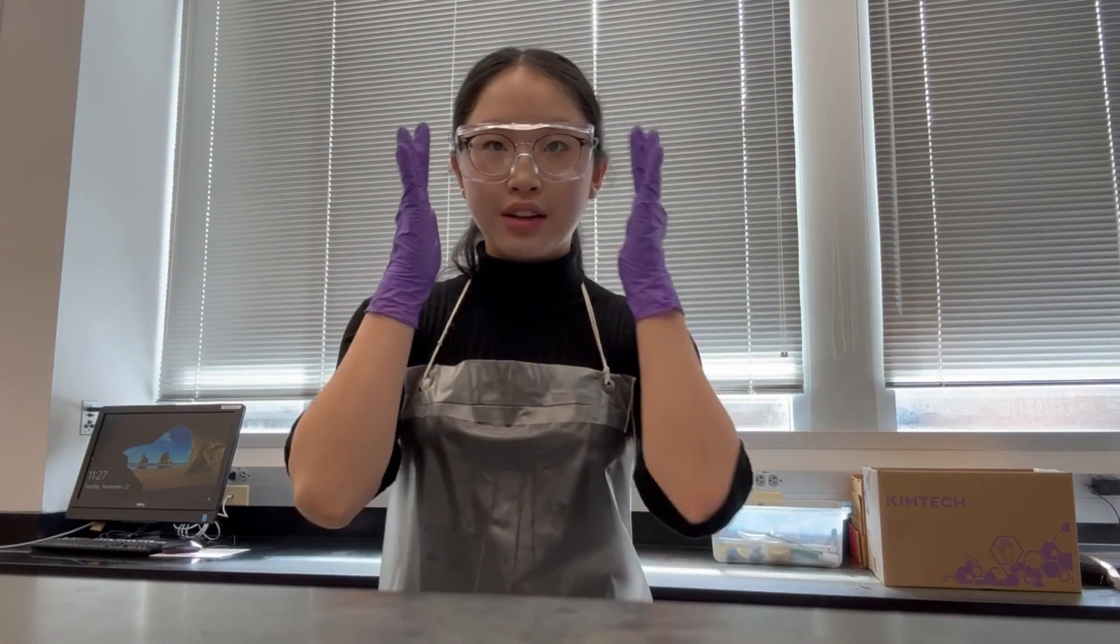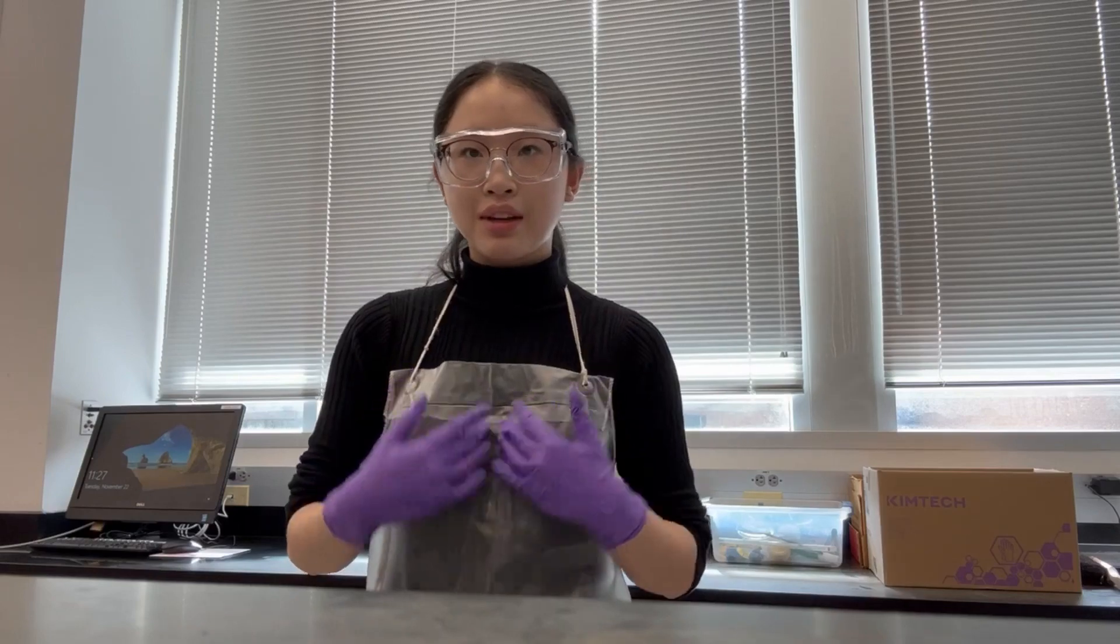Hello, today we'll be observing the appearance and odor of soap as well as preparing a soap through the process of saponification. Make sure to wear your safety glasses, gloves, aprons, and if you have long hair, tie it back.